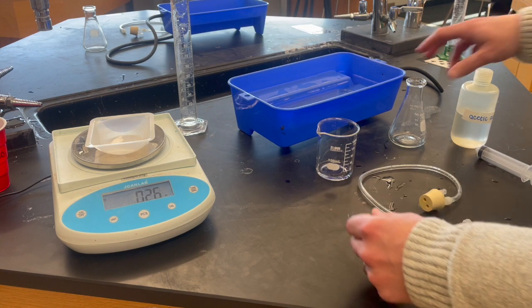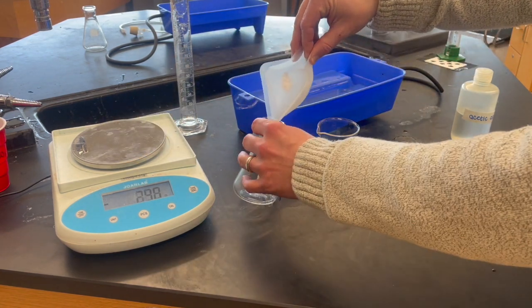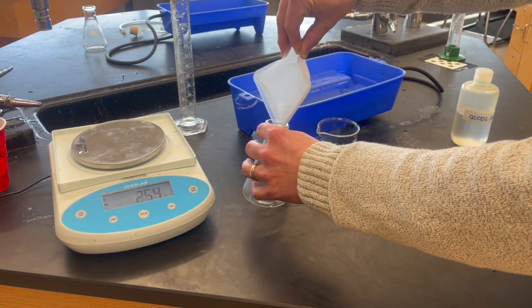I'm going to transfer that mass into my Erlenmeyer flask here to be prepared for mixing.